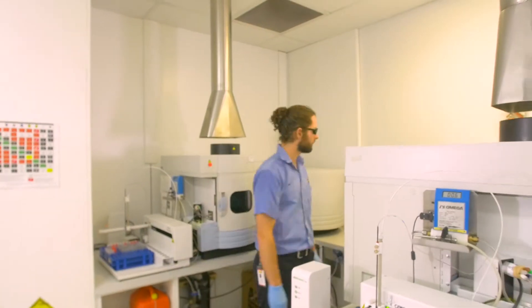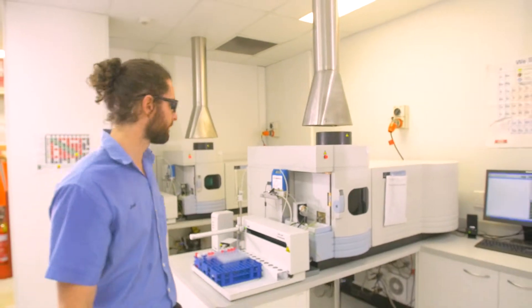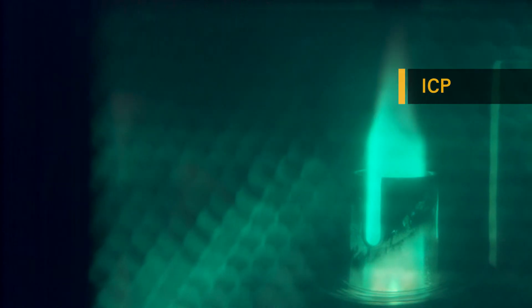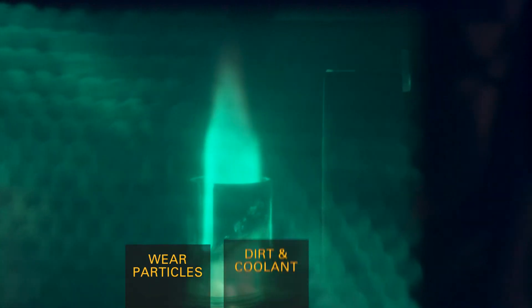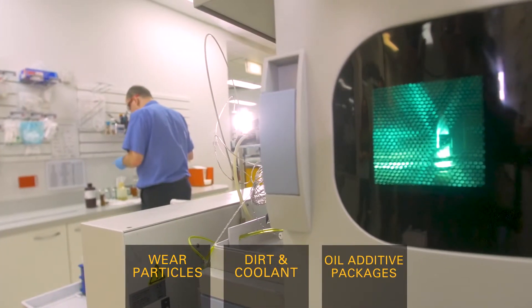Testing by inductively coupled plasma optical emission spectrometer, or more commonly known as ICP, allows monitoring of wear particles, contaminants such as dirt and coolant, and oil additive packages.